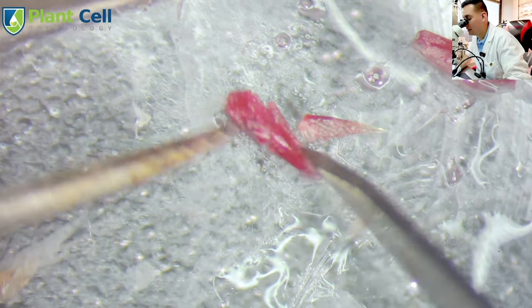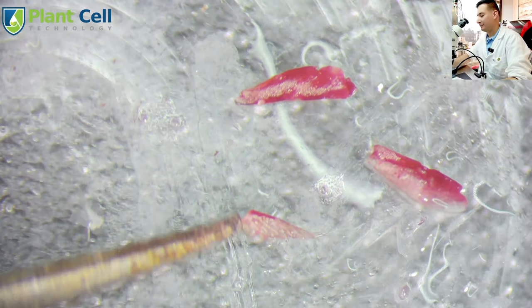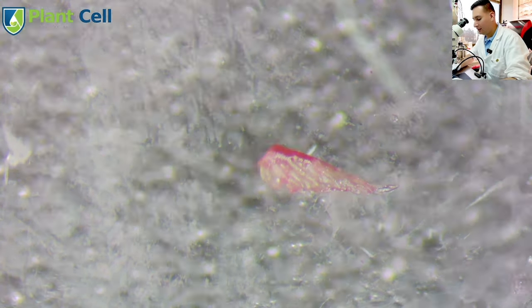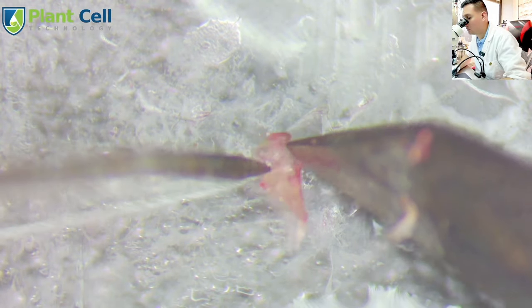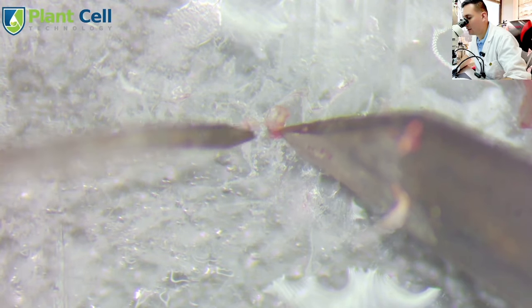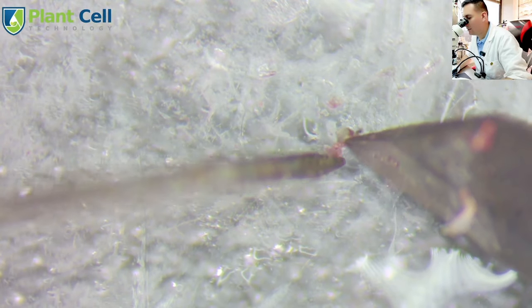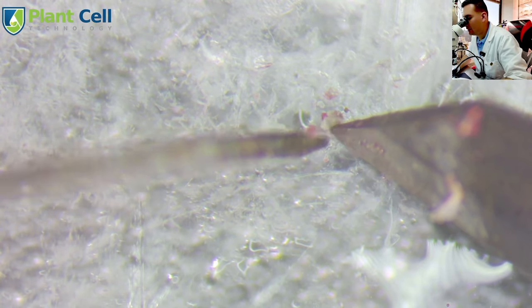While you watch this example, I want to explain the process of using the meristem for tissue culture. First, you would need to sterilize the entire shoot tip prior to dissecting the apical meristem. Depending on the type of plant you're working with, the sterilization method is going to be different, so I'd recommend looking for a specific protocol for your plant. But generally, a good place to start is a 10% bleach solution for 10 to 15 minutes. Then you would place a microscope inside the laminar flow hood to do the sterile work and the actual dissection. Once you have the meristem, you can place it directly onto the TC media like any other explant. Here it is, ladies and gentlemen — the meristem.